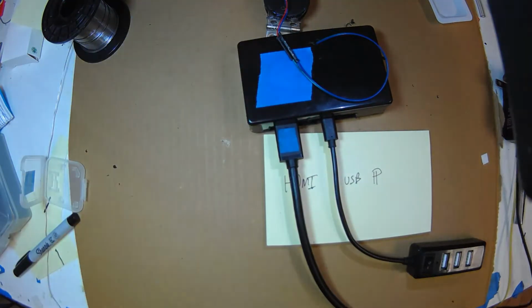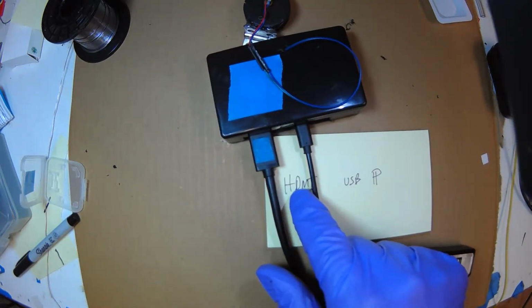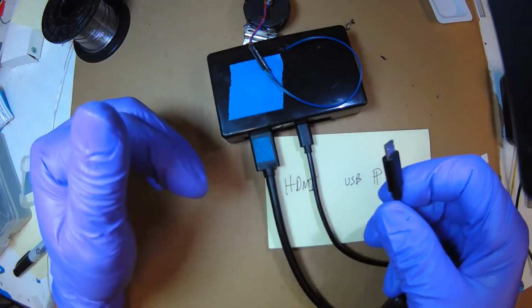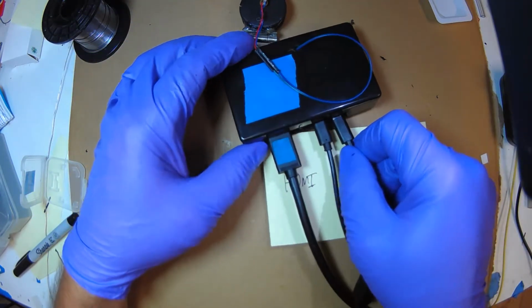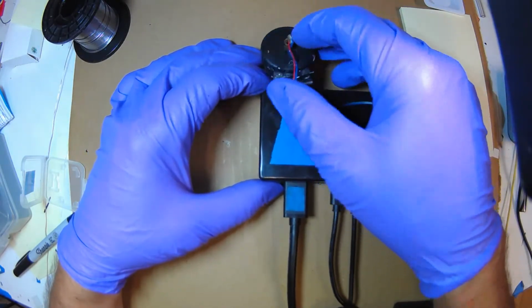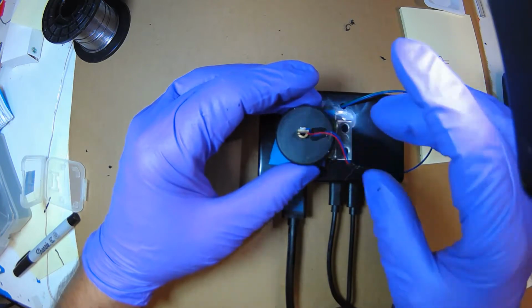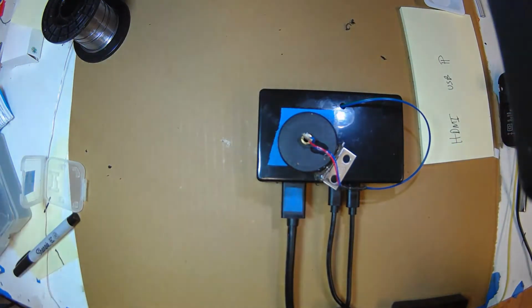And finally, power. It's not plugged in yet because you need to have the HDMI plugged into a monitor before you power it up. Otherwise, it won't discover it, and if you plug it in after it powers up, you won't get any signal and you'll wonder what's going on. Okay, so now what I'm going to do is power it up, and I'm going to move this around till I get the image I like, and then I'm going to tack this down and then glue it down permanently, and then glue the cable in, and then we're done.